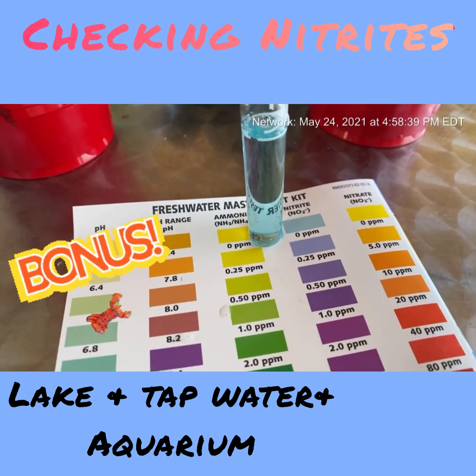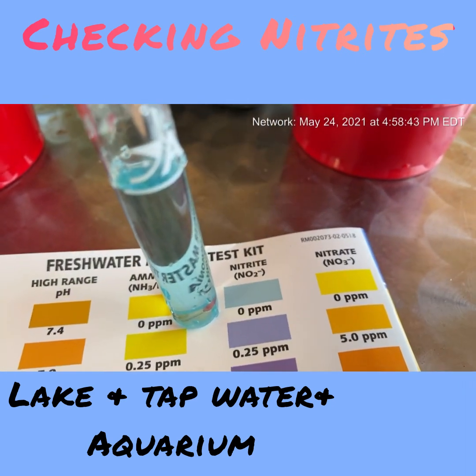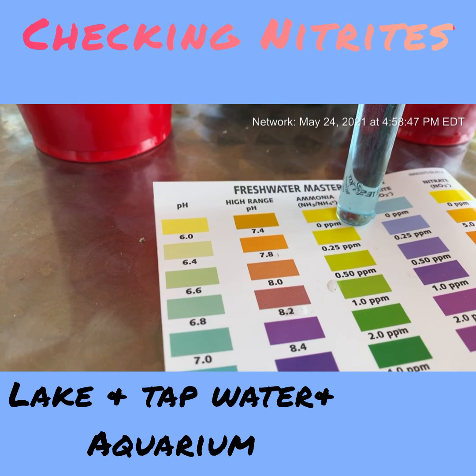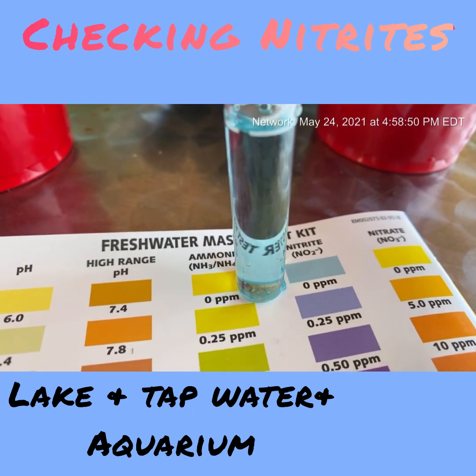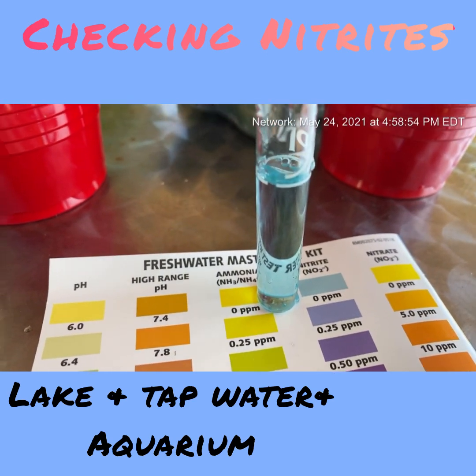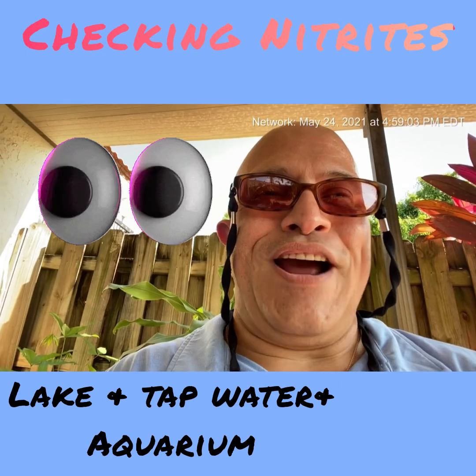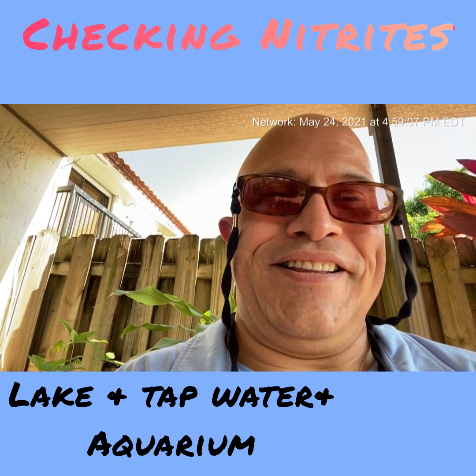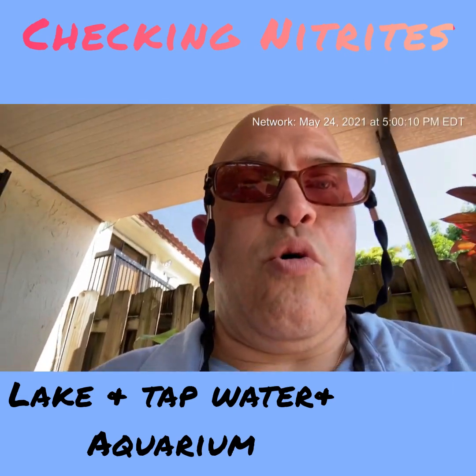Continuing with nitrite testing — the tap water also has no nitrites. I'm double-checking in case my eyesight is off, but nope, no nitrites in the tap water. That's good. Now I'm nervous about testing the aquarium water. Let's check it out — drum roll please!